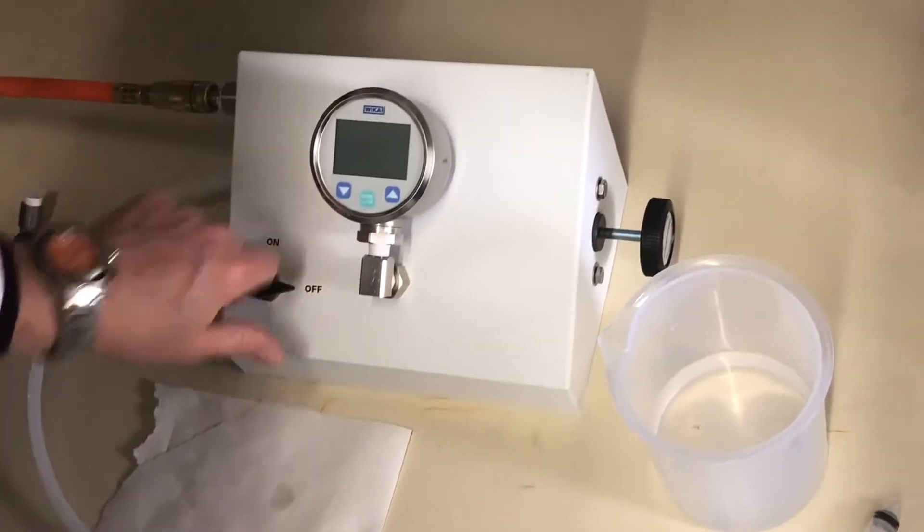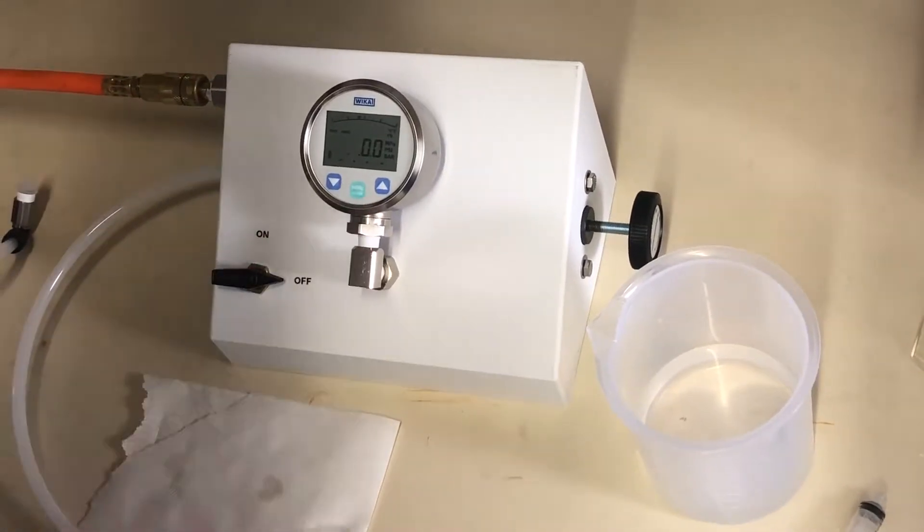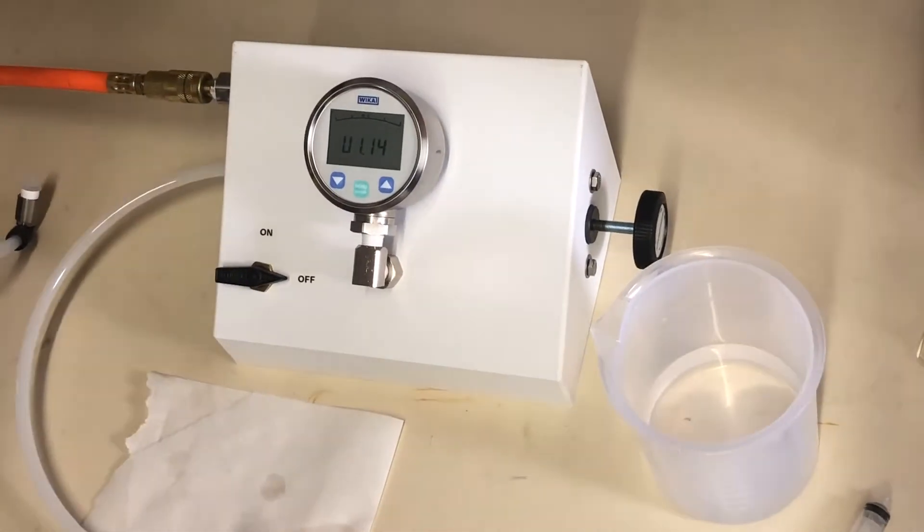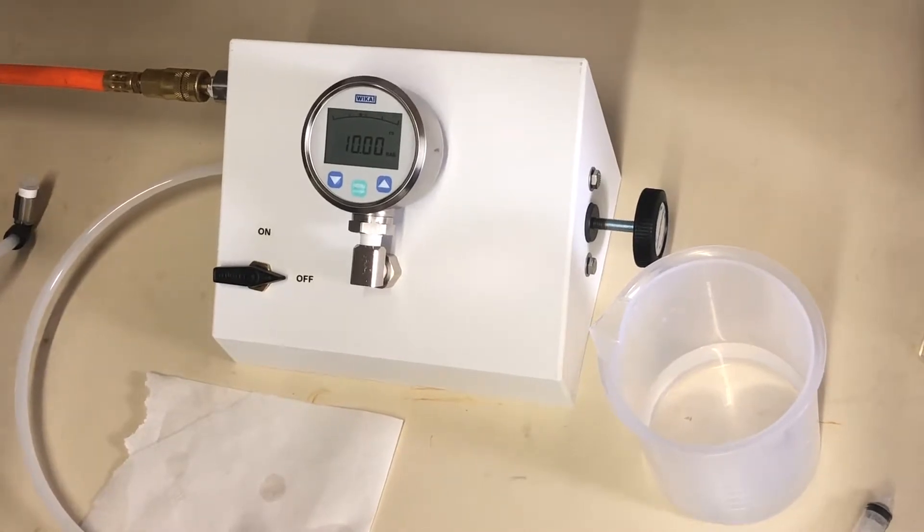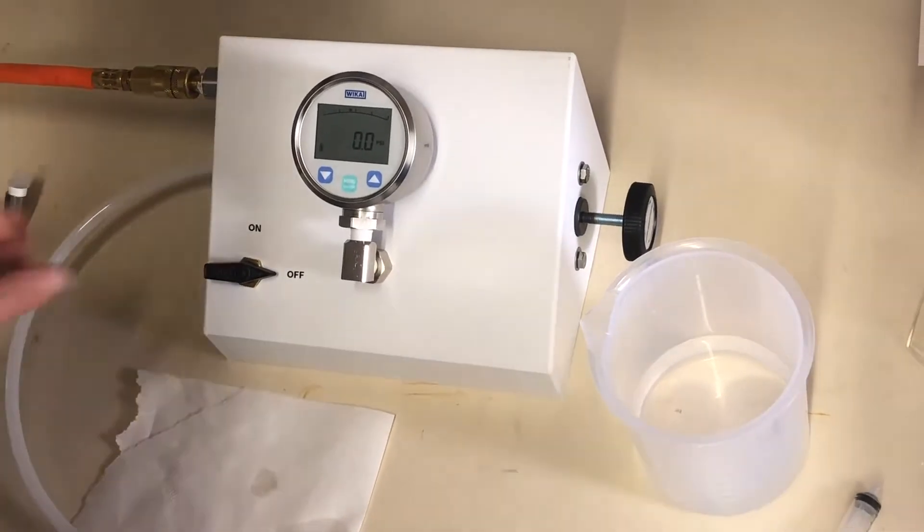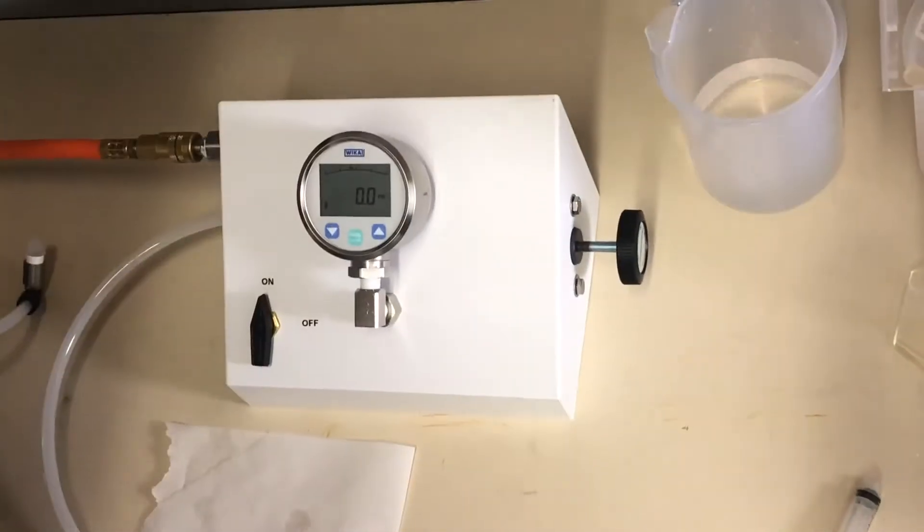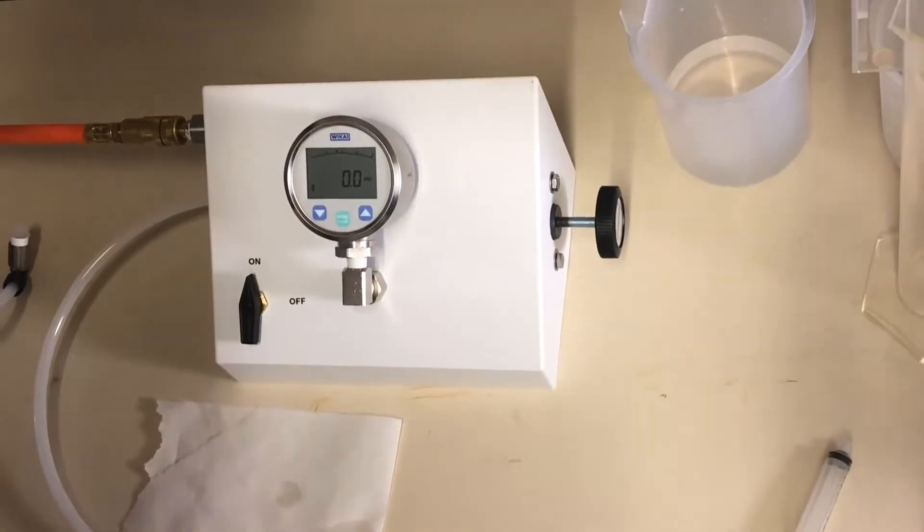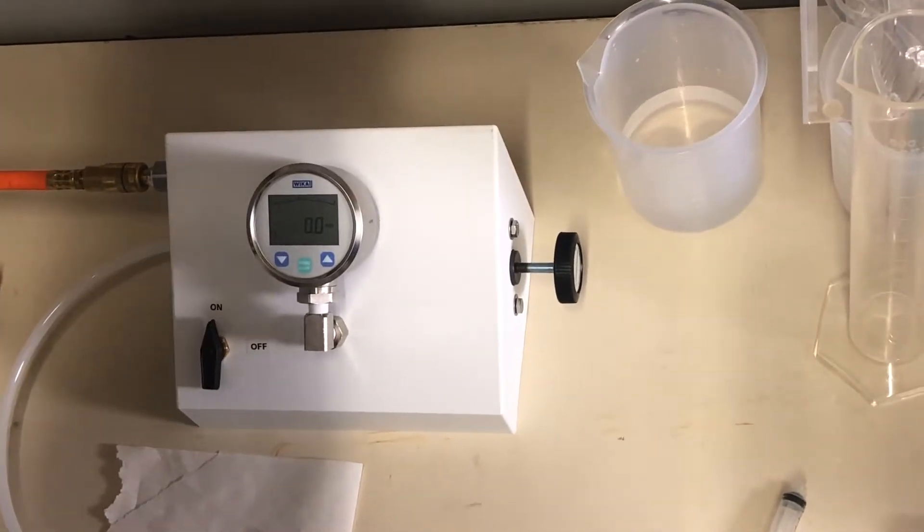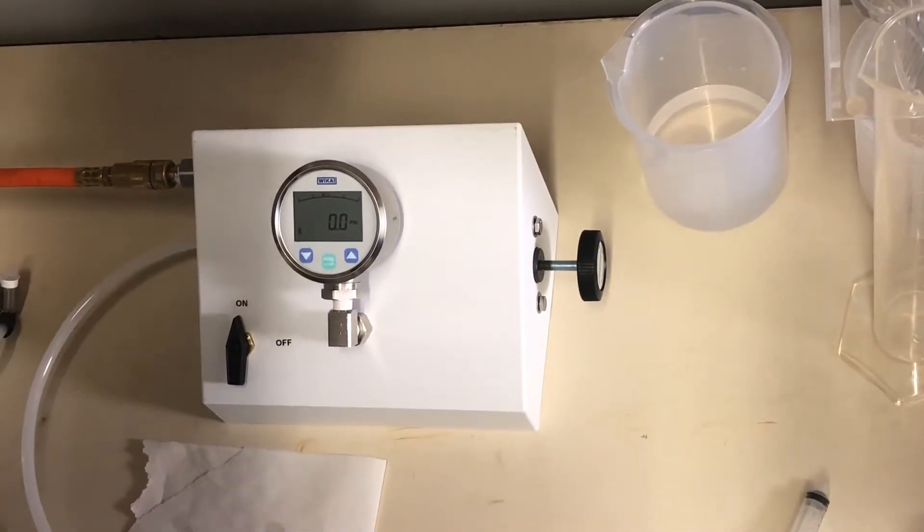We'll turn on the gauge, make sure it's reading zero. Alright, we're at zero. We'll turn on the air.